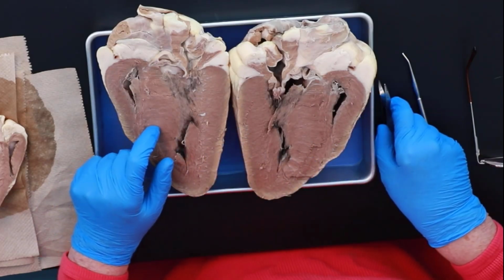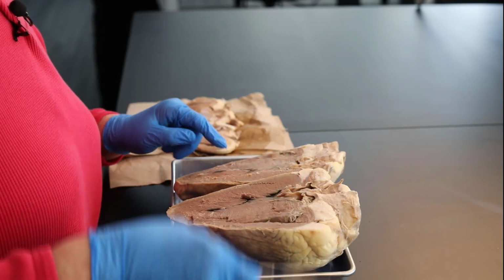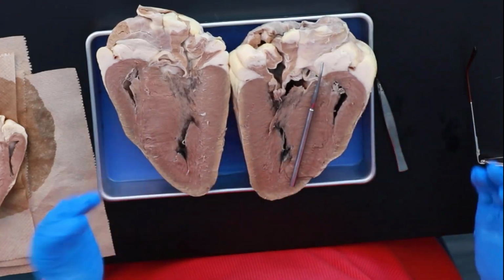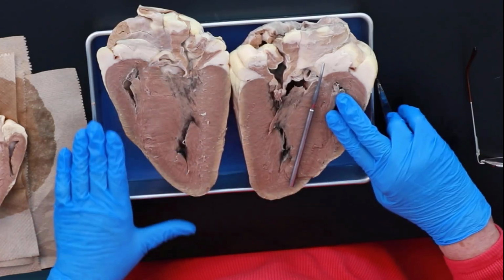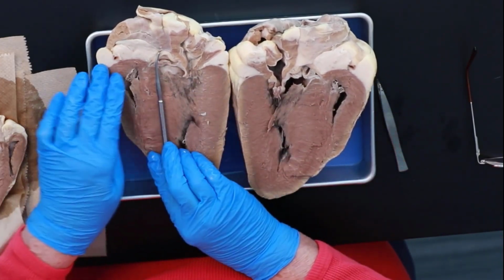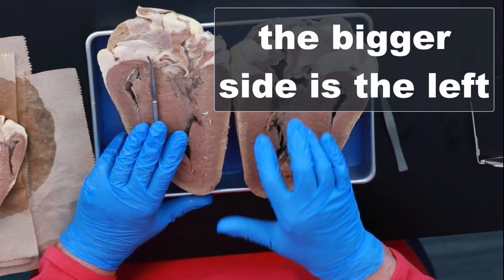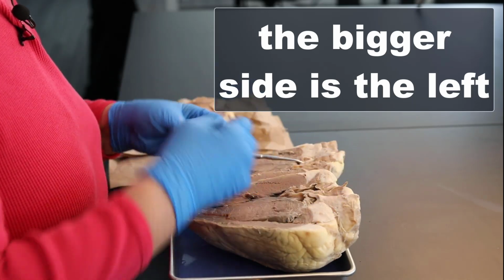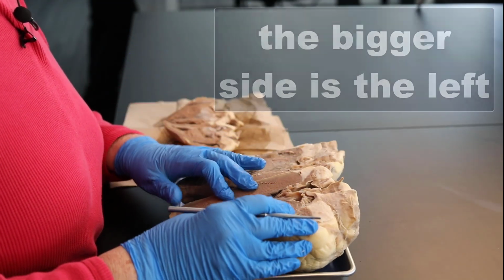Interventricular. And what you look at is whichever side, if I'm going to put my pointer right here, so I'm going to line it up right down the middle of that septum. Which side is bigger? Well, obviously this side is bigger and this side is smaller. Run it over here. This is the bigger side, this is the smaller side. Always, always, always the bigger side is the left because that's the one that's doing systemic circulation. That's the side that's got to send all this blood to the rest of the body.